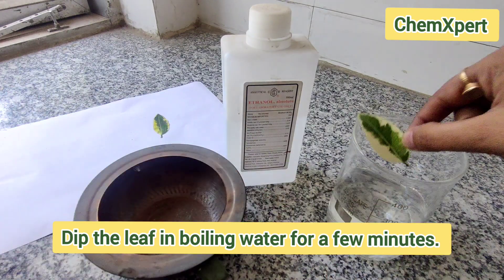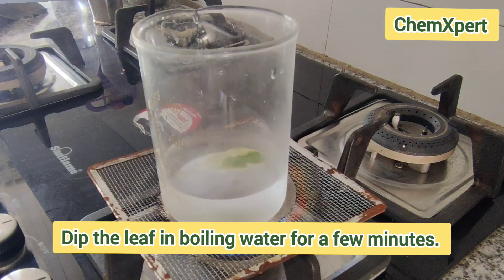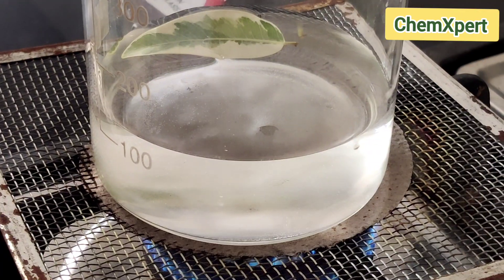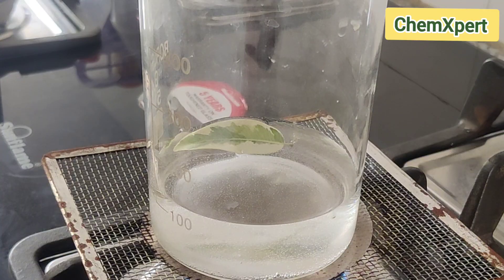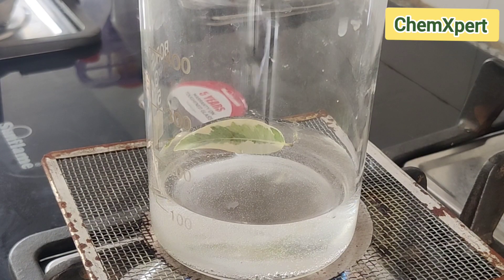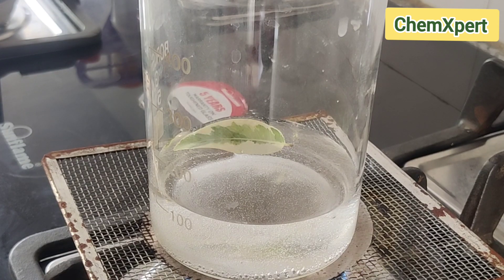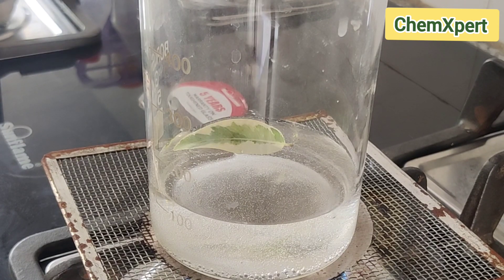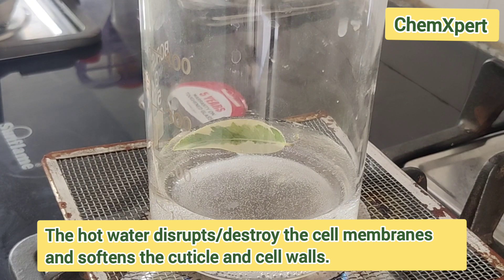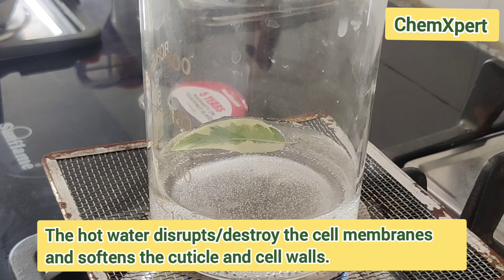The next step is to dip the leaf in boiling water. I have dipped this leaf in boiling water for a few minutes. A reasoning question here: why are we dipping this leaf in boiling water? Boiling water will disturb the cell membrane, softening the cuticle and the cell wall.